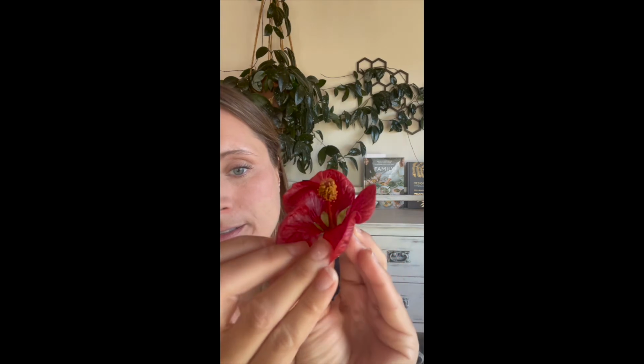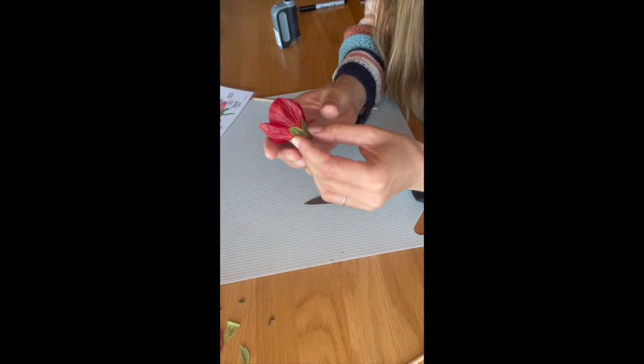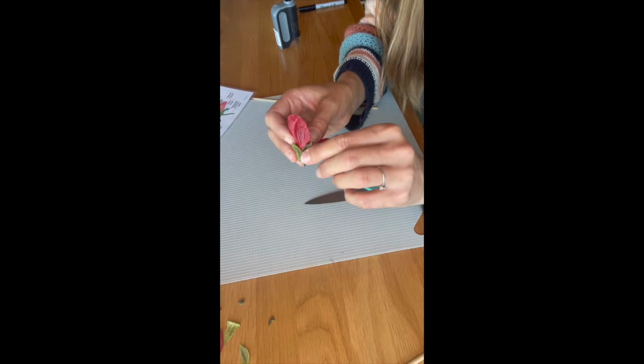Looking at our flower that we have on our table, you can see here the stem at the bottom. The green leaves are the sepals. Then we have the colorful petals, which attract pollinating insects and birds. And inside we have the male and female parts, which we'll take a closer look at. So we're going to start by pulling off the sepals of our flower.